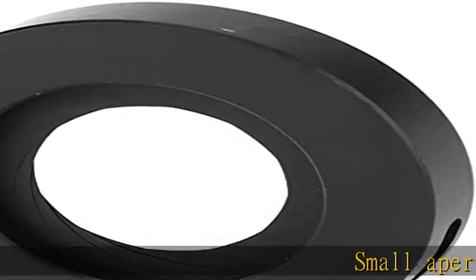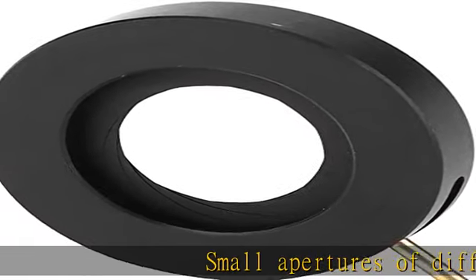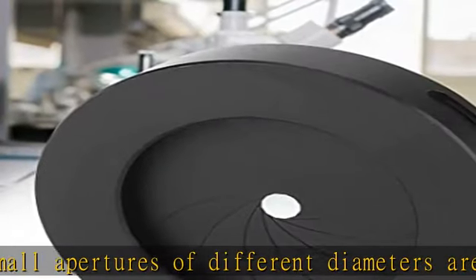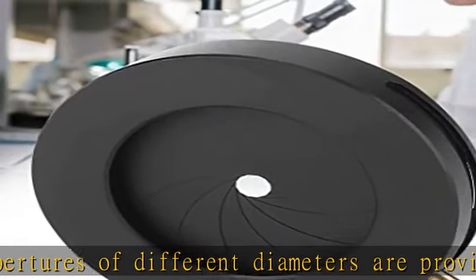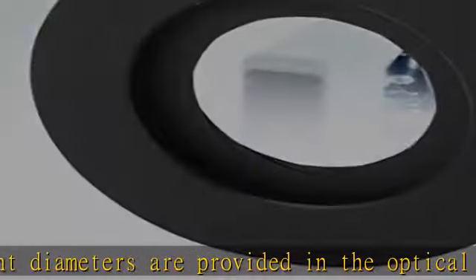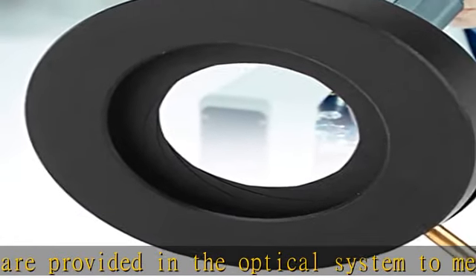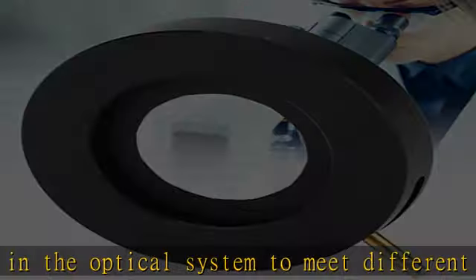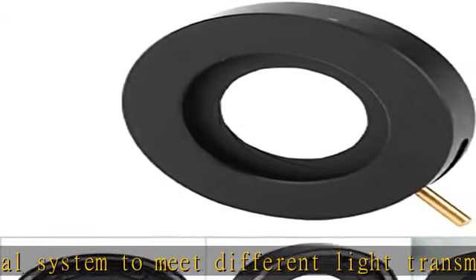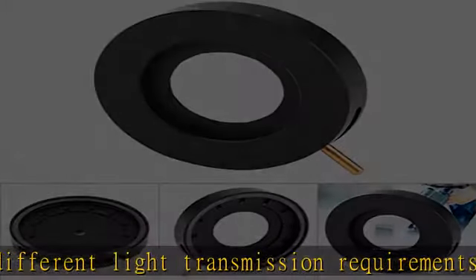Small apertures of different diameters are provided in the optical system to meet different light transmission requirements. Change the diameter of the aperture by the handle. Metal material, reliable performance, durable. We provide 5 kinds of aperture for you to choose from to meet different requirements.